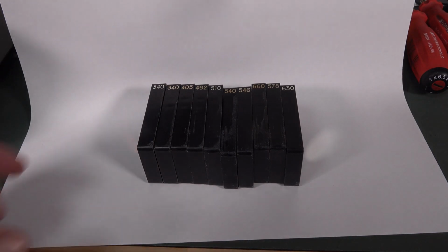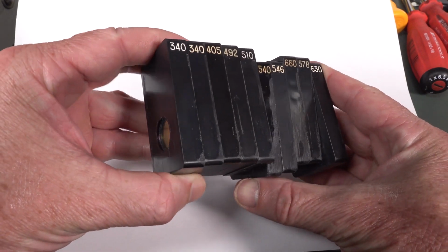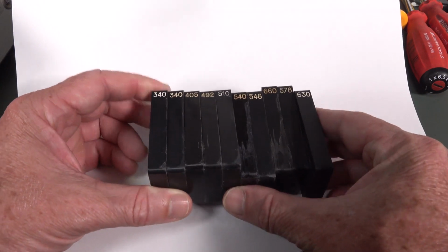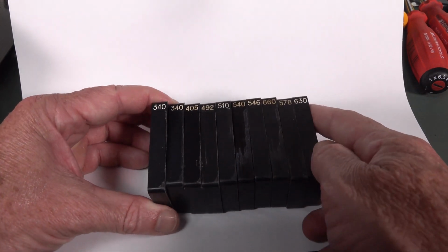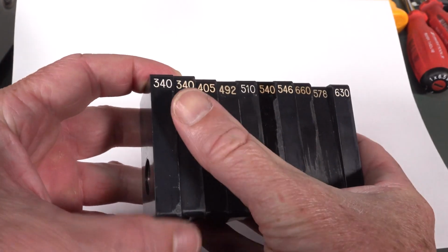Hi, just a quick follow-up video on these filters for the spectrophotometer that I did a mystery teardown of on the main channel. I thought we'd have a slightly better look at these because they must be very narrow bandwidth. This is the bandwidth.